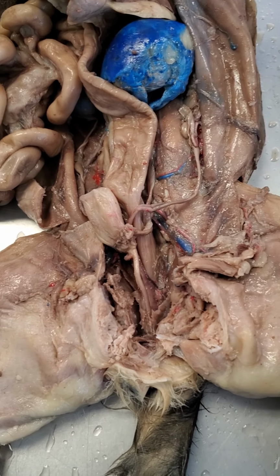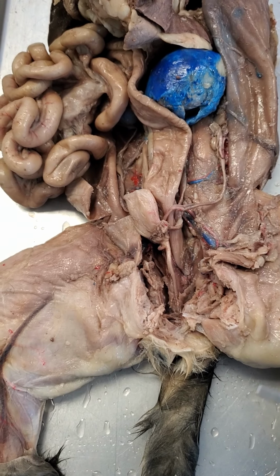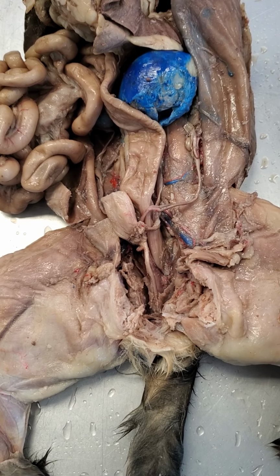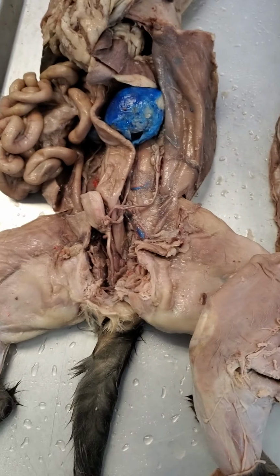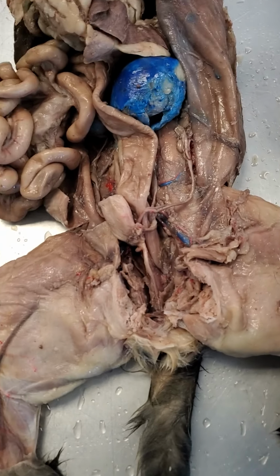And so, of course, the first thing you want to do on both of these, or whatever you see on your exam as images, is to identify right away if it's a male or female before you can start identifying the actual specific structures. So the first thing we can do before we dive into the actual female is look at the two of them, and we can find some pretty distinguishing characteristics. A lot of them are pretty obvious, which you may already know.